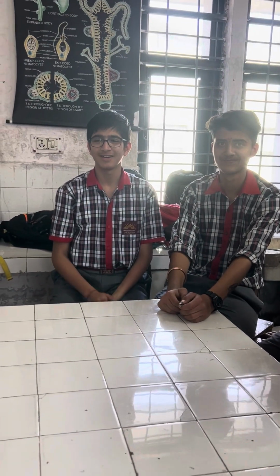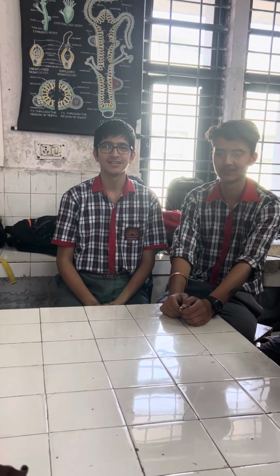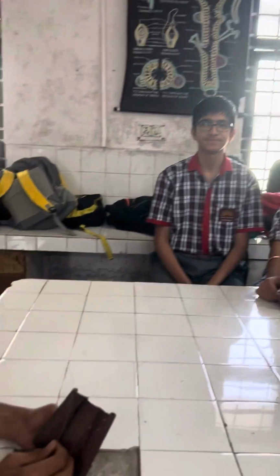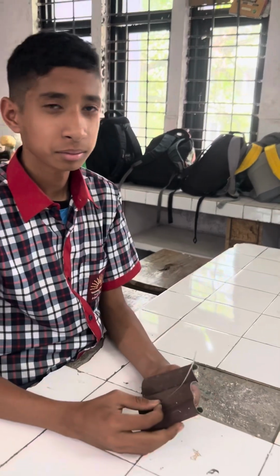Today we are going to burn magnesium ribbon. So it will be an example of combination reaction. Okay. Then what is your friend doing?